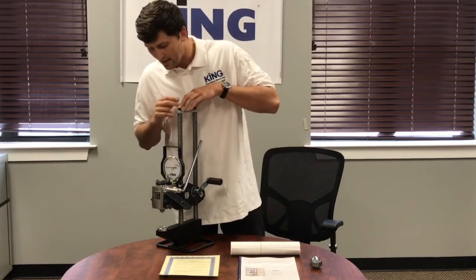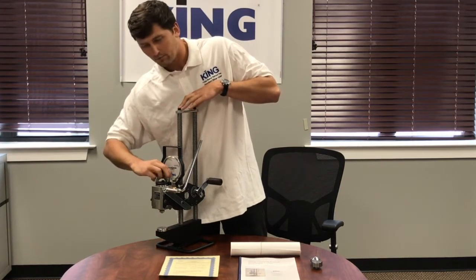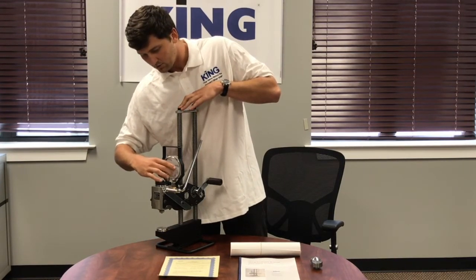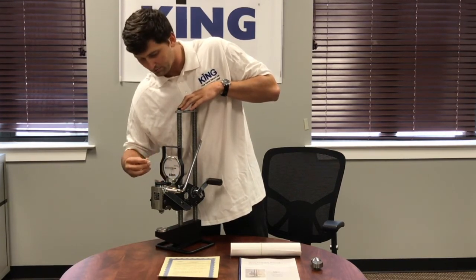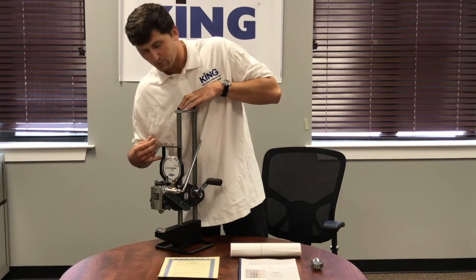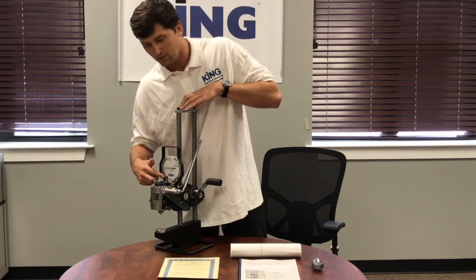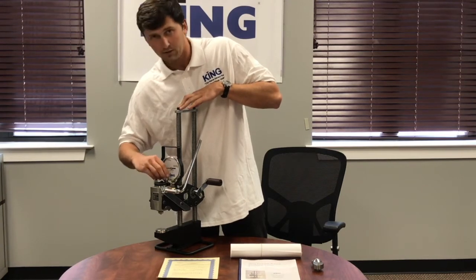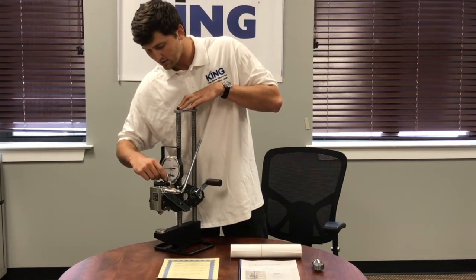Moving on to the test head, we have our external calibration assembly. If you're looking to change the force you want to apply on our high pressure test head, you can move it down to 1,500 kg. It's a simple hex key or Allen key that you would adjust. Then you can verify it against a hardness test block that is certified.